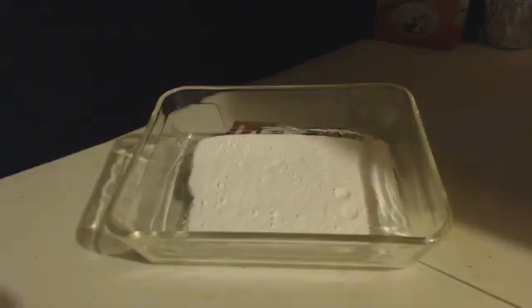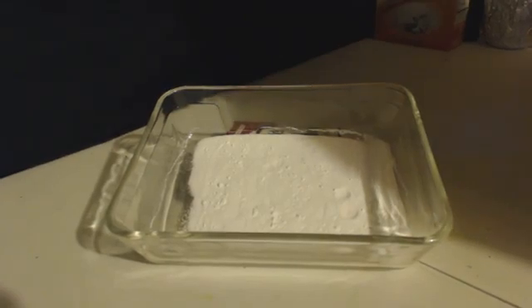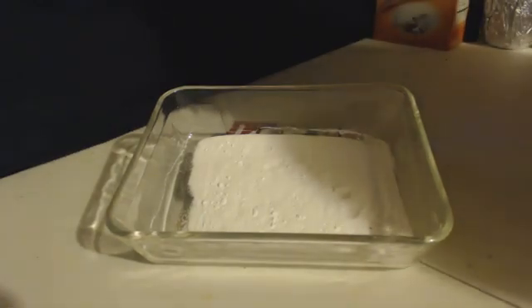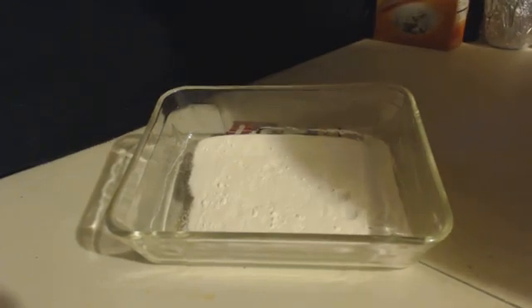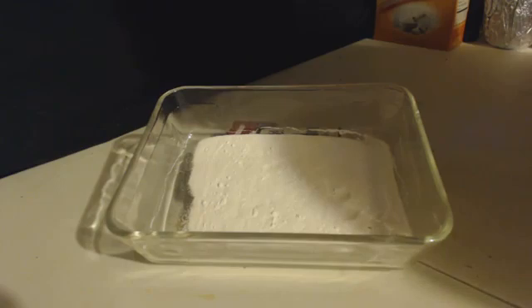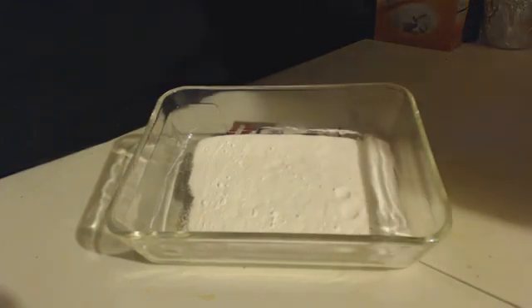I actually wanted to show you how this when you put it in the oven turns into liquid, most of it, and it kind of dissolves within that liquid. It didn't happen in this case. I'm guessing because I had so little that it just evaporated. This only took me about 45 minutes to do, and normally I'd do this for hours with a larger amount.